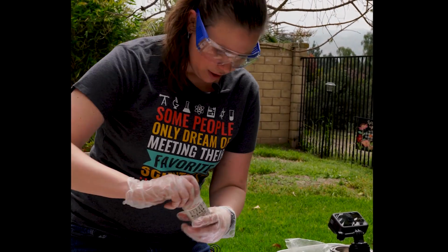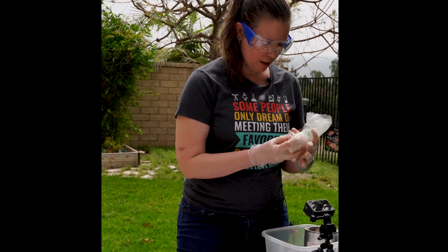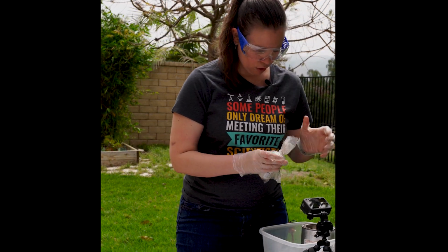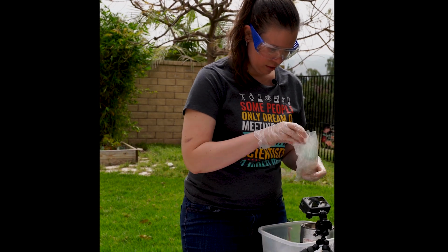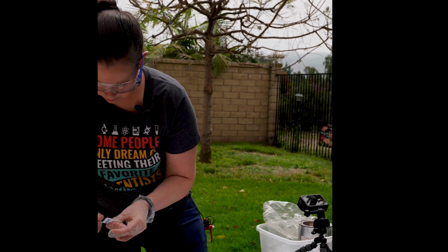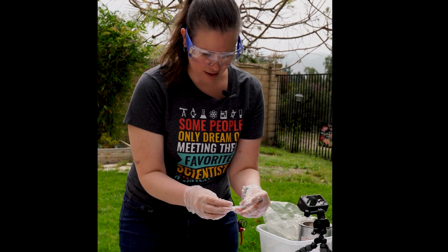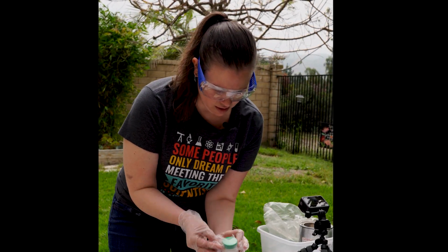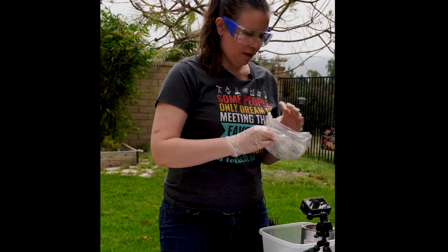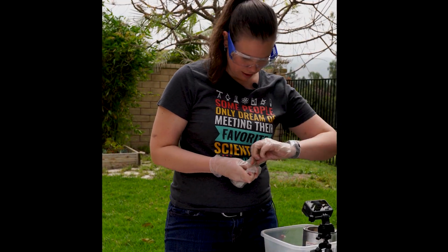Now that I've showed you the sodium piece, I'm going to put it back away. We've got to put these things back in storage right away. So back in the bag, bread tie. Oh, nope, forgot the parafilm. Fresh piece of parafilm every time. We're going to spread that out so that it makes a nice airtight seal around the cap. Protect the sodium from the air. Then back in the bag, then bread tie, twisty tie.